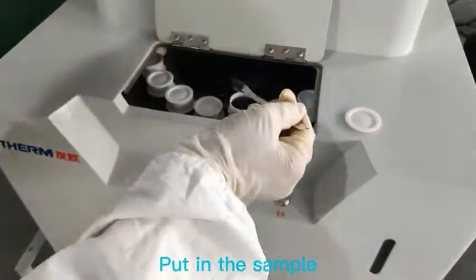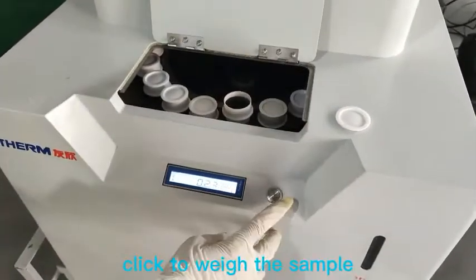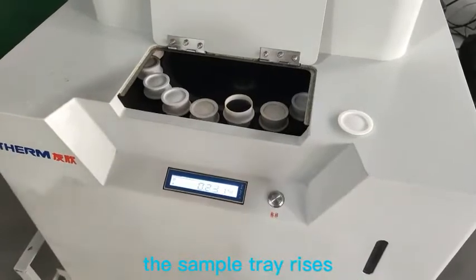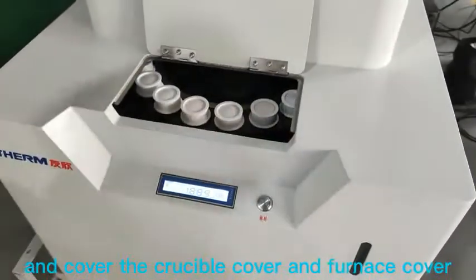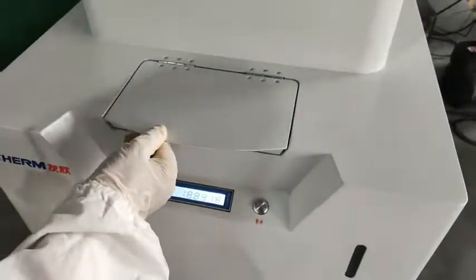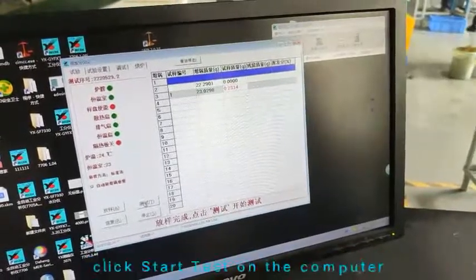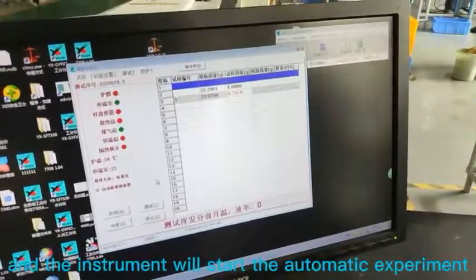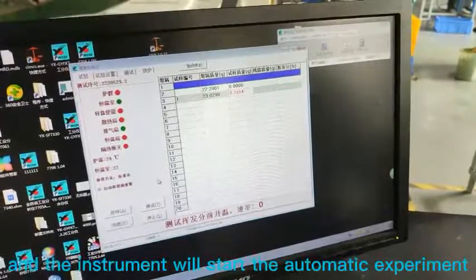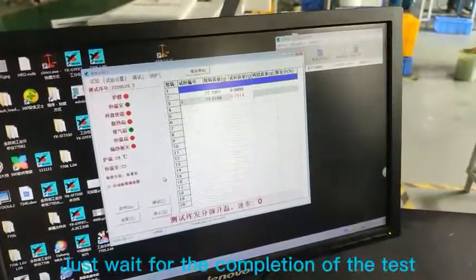Wait for the display to show that the balance is cleared, then put in the sample. Click to weigh the sample; the sample tray rises and the cover closes over the crucible and furnace. After the setting out is completed, click start test on the computer and the instrument will start the automatic experiment — just wait for the completion of the test.